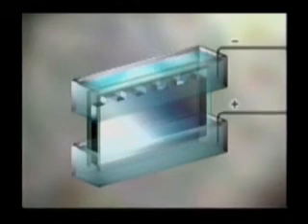The gel is mounted between two buffer chambers. An electrode is in contact with each chamber, one positive and one negative. So when voltage is applied, an electric field is generated across the gel. Charged molecules will move in this field toward the electrode of opposite charge. Let's see what this phenomenon, called electrophoresis, can tell us about 7A and STF.